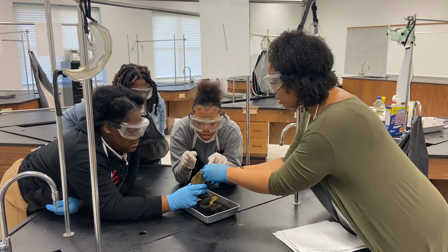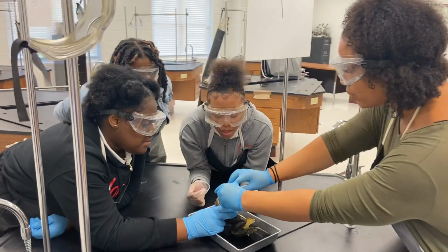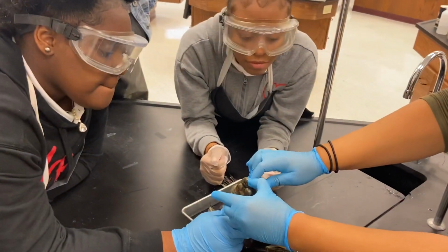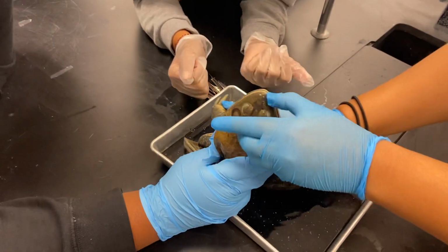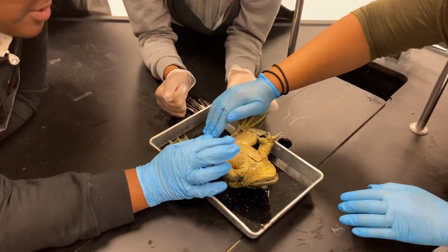Held it up like this, and then we opened up the mouth, right? So we cut along the sides, and what was that structure, that long tube structure? The esophagus is the part that allows the food to travel down, right? So we saw that that's the opening. Then we laid it on the dorsal side, and this is the ventral side.